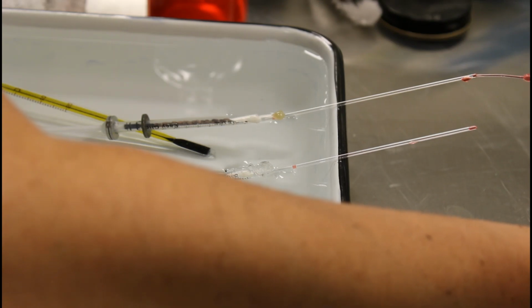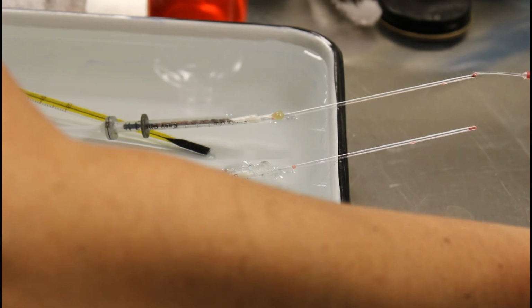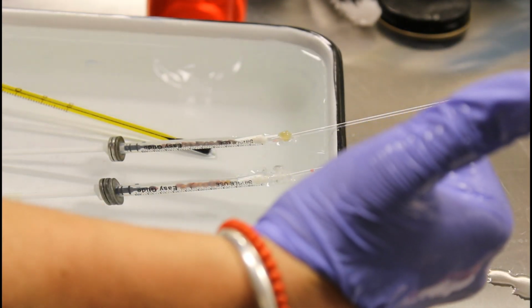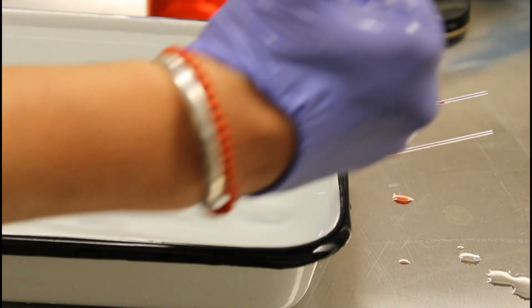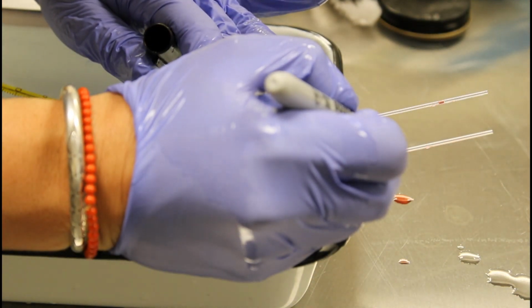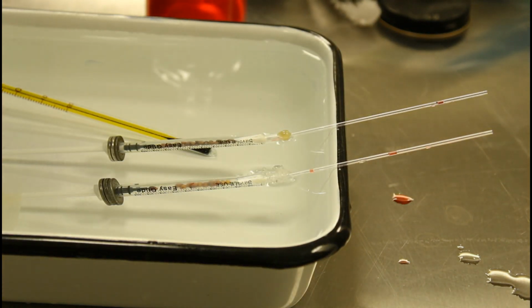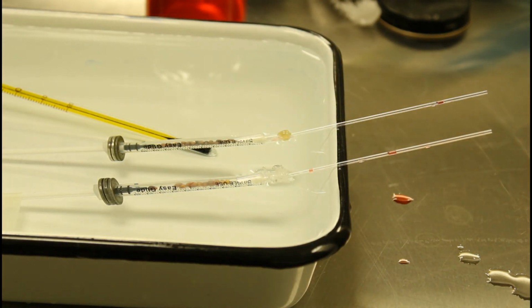And this is sealing the tubes. Get a little more in here. And I'm just going to pull these down. All right, so I kind of sucked the drops of manometer fluid down the capillary tube a little bit. And now I'm going to put a mark on each of our capillary tubes, showing us the initial position of the bottom of that drop of fluid.